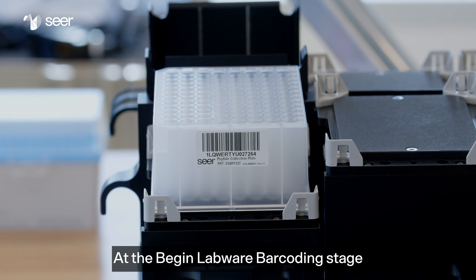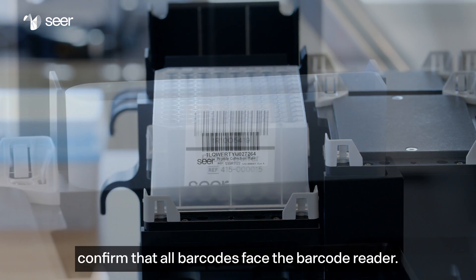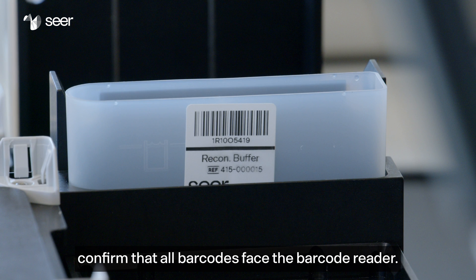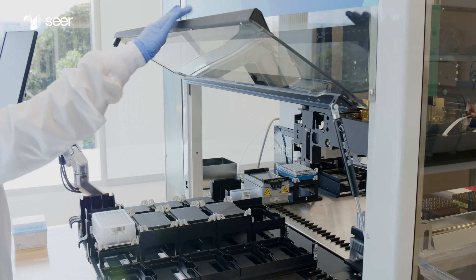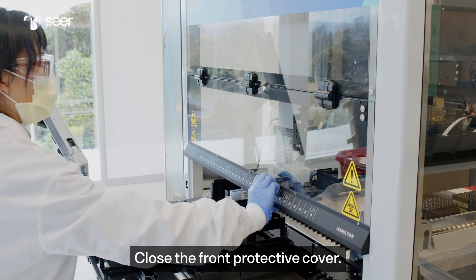At the begin labware barcoding stage, confirm that all barcodes face the barcode reader. Close the front protective cover.